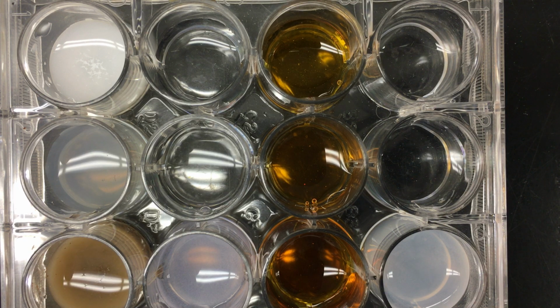If a reaction takes place, a solid forms, and when the solid forms, it makes the solution not clear anymore, or not transparent. It makes it kind of a milky color, and that milkiness may be white, but it could be a different color. For instance, you can see down in the lower left-hand corner here, this one is a brown color, but it's definitely a solid that is formed. So that's the experiment for the double replacement lab.